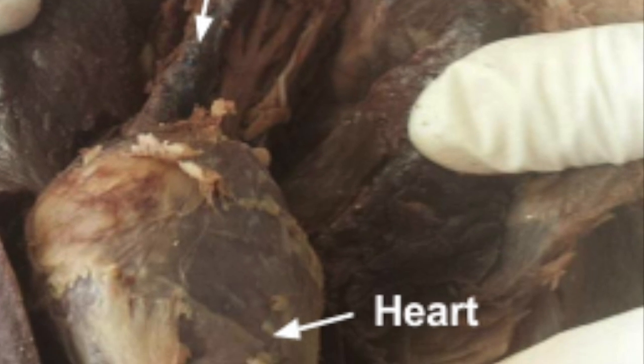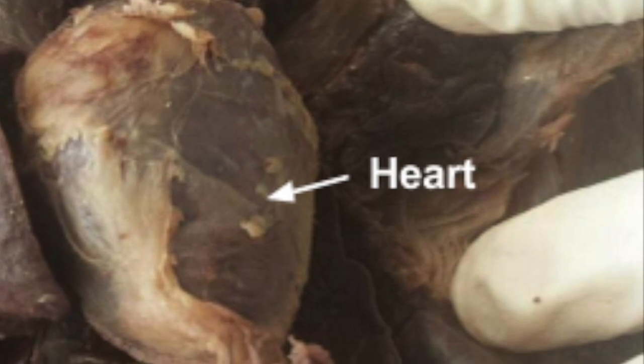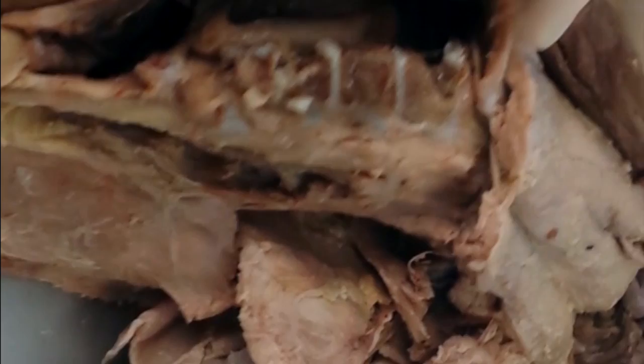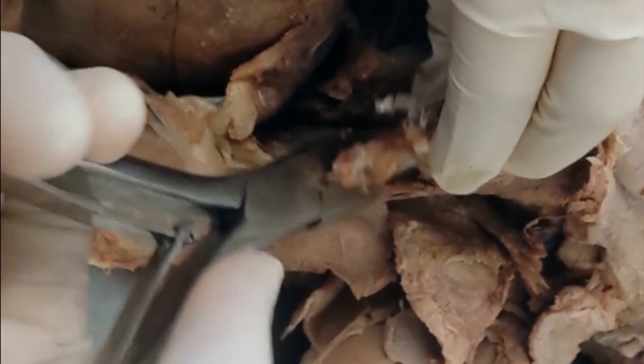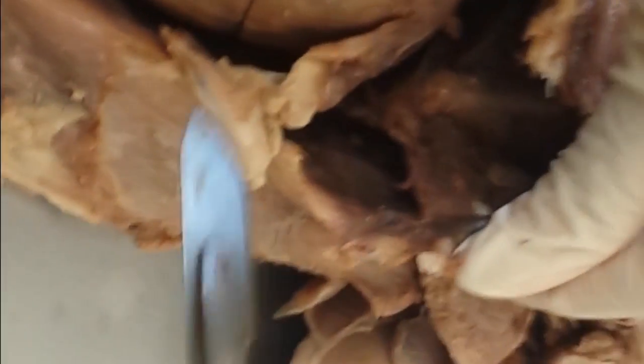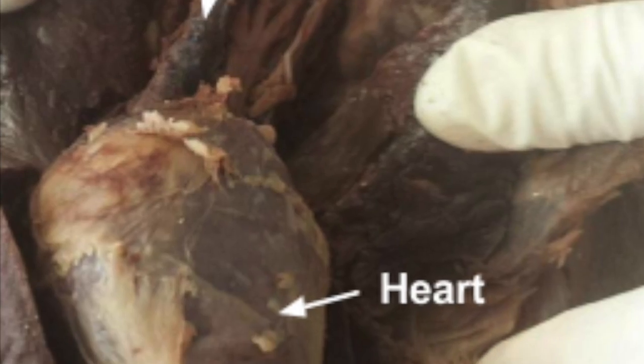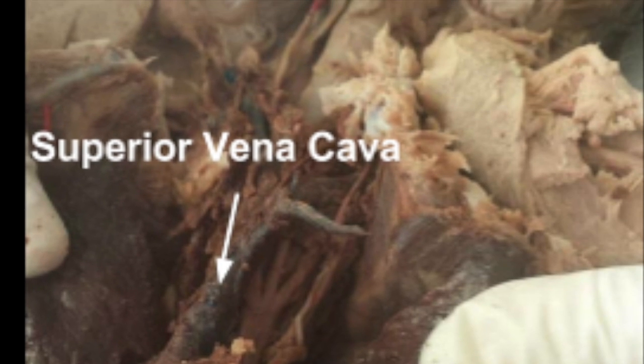Another internal organ in the cat's body, as well as ours, is the heart. It is a part of the cardiovascular system. This system is responsible for the transport of vital nutrients throughout the body, as well as removal of metabolic waste such as carbon dioxide or nitrogenous waste. The cardiovascular system also helps protect the body and regulate body temperature. The cardiovascular system is made up of numerous components such as the heart, blood vessels, and blood.